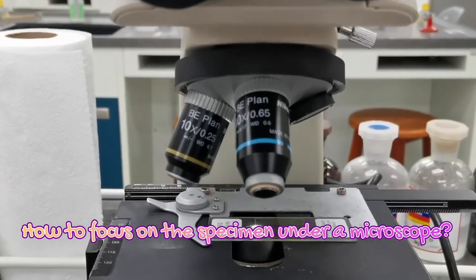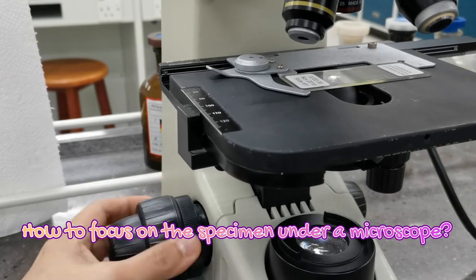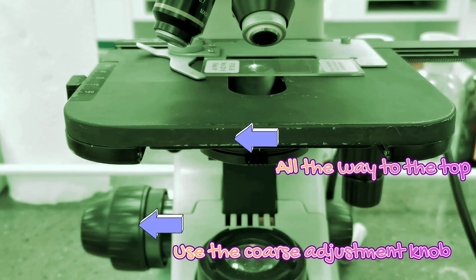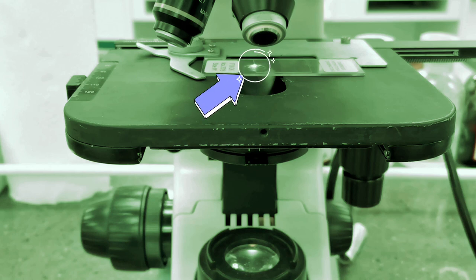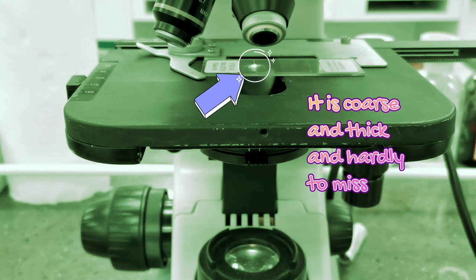Now we will look at how to properly focus and view a specimen under the microscope. First, use the coarse adjustment knob to shift the stage all the way to the top. For a start, I will focus on the edge of the cover slip, because the edge is coarse and thick and is hardly easy to miss.